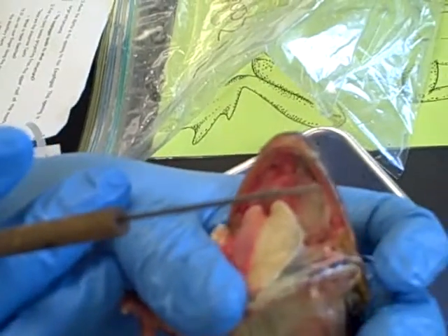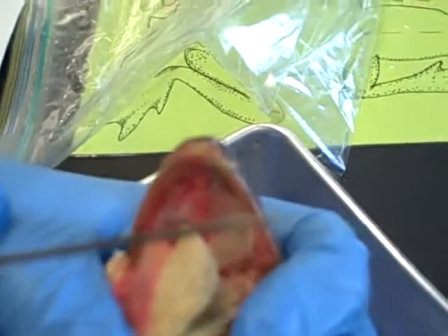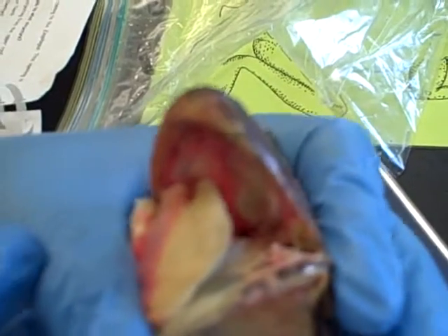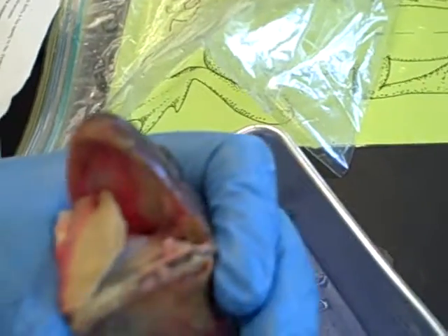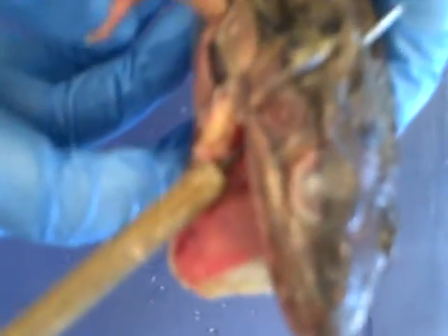The openings of the Eustachian tubes are located near the corners of the mouth on the upper part of the mouth. Gently insert a needle into one opening and push it — it comes out above and behind the eardrums. The tubes link the pharynx to the eardrum and help to equalize air pressure.